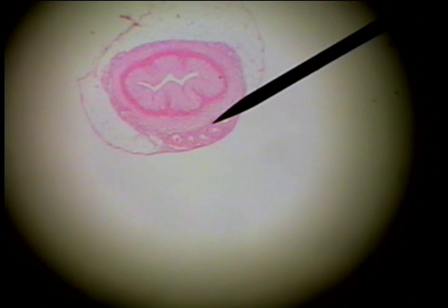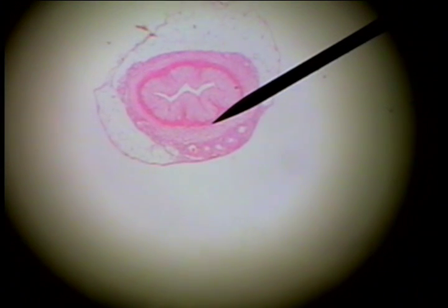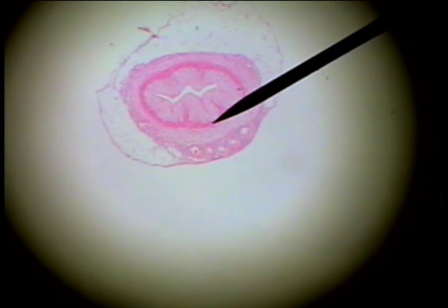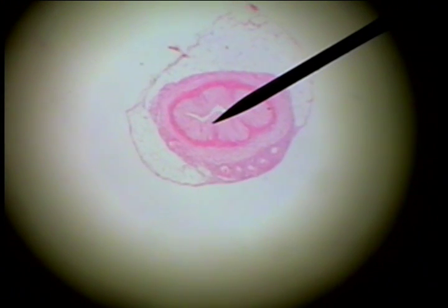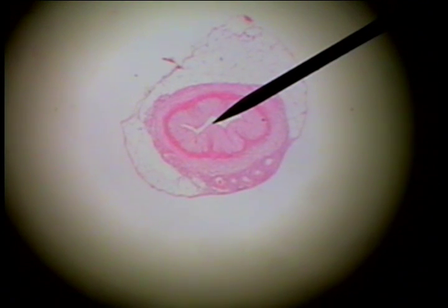Here's some nerves, arteries and veins here. Here's the thick, smooth muscle wall. Here's the lamina propria or connective tissue, and then transitional epithelium here and a rather irregularly shaped lumen.